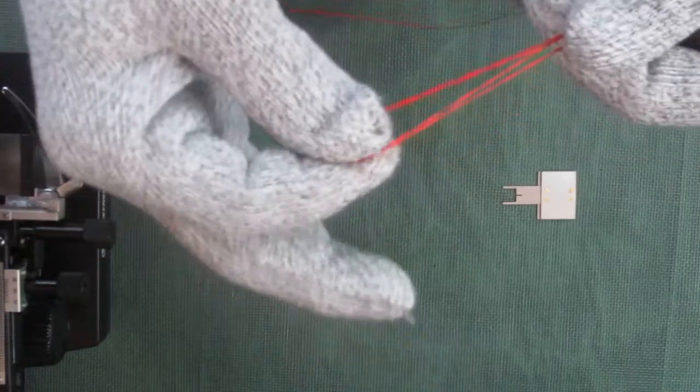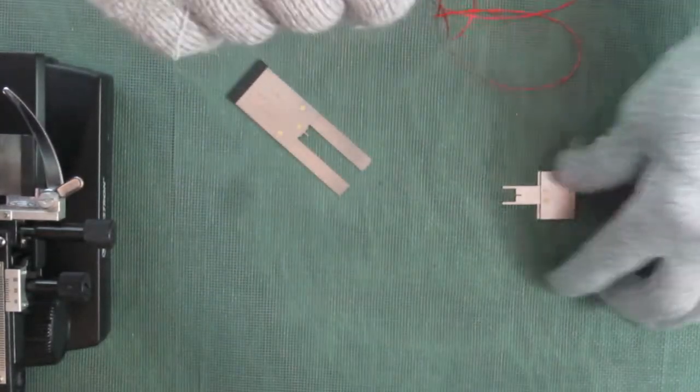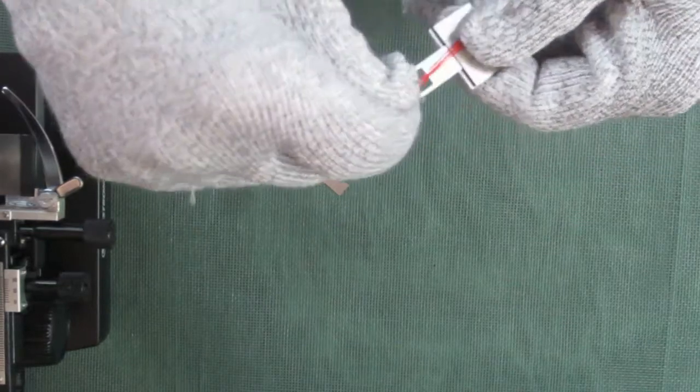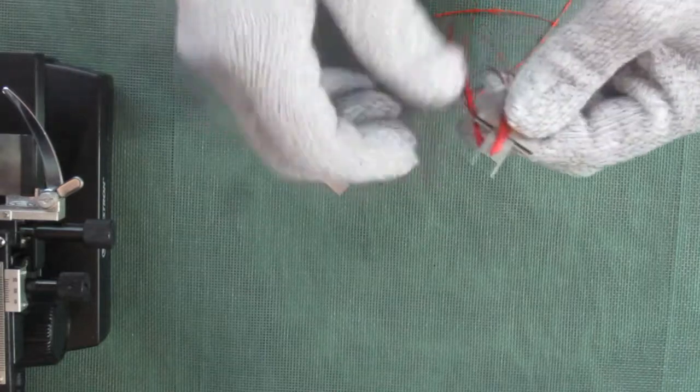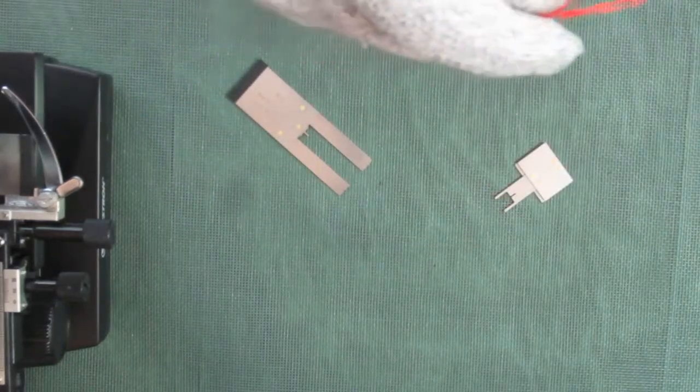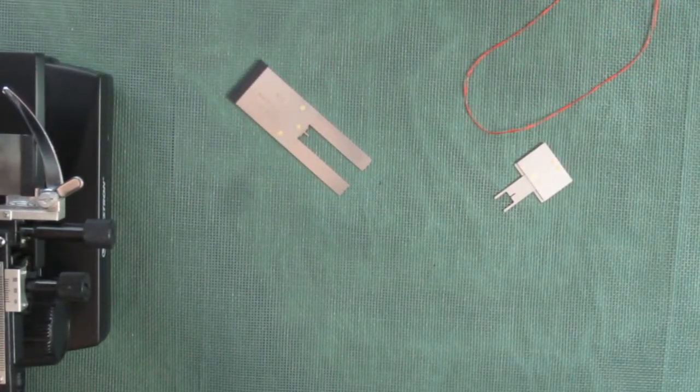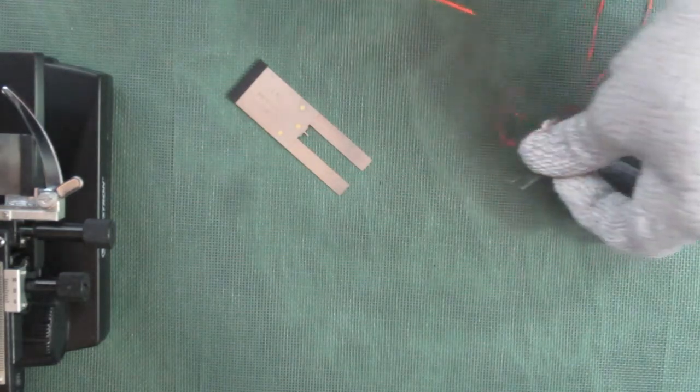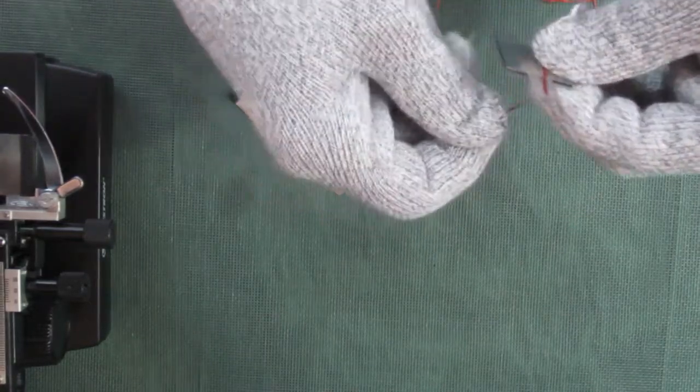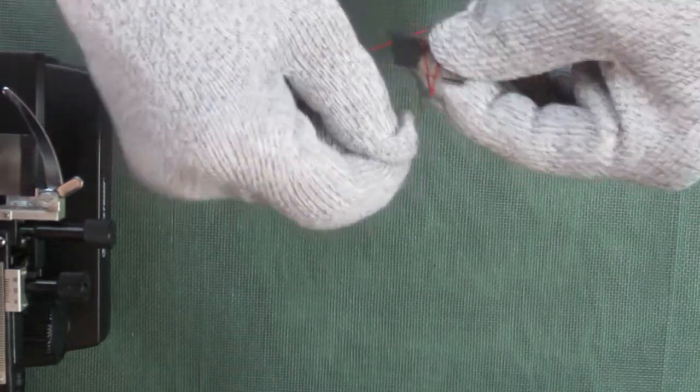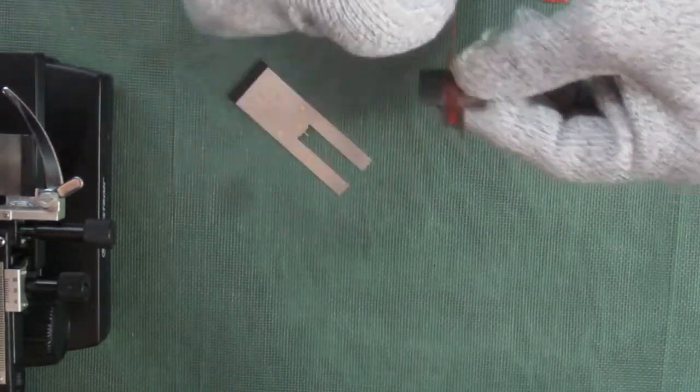I'm going to use this here. Now you could just loop it a few times as such and stick it in that way. And also a lot of people like to loop it and just do it this way.